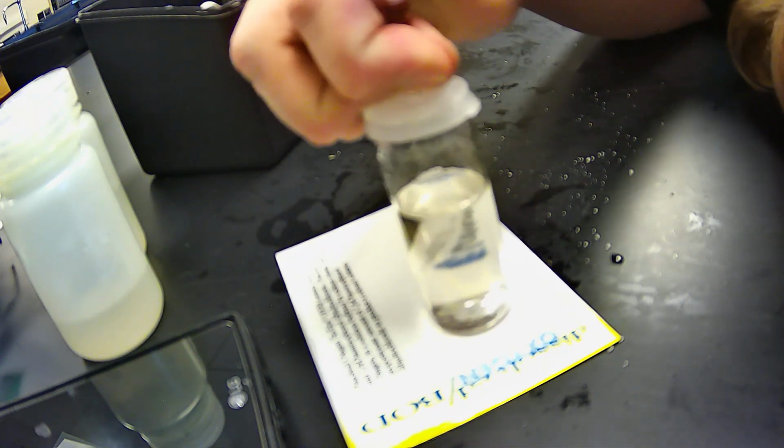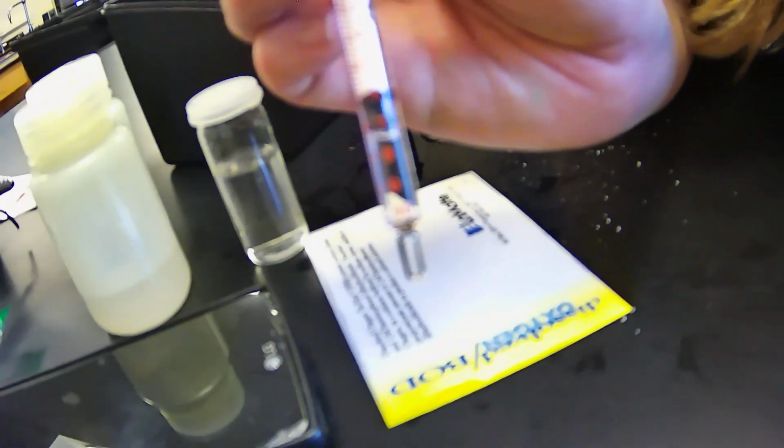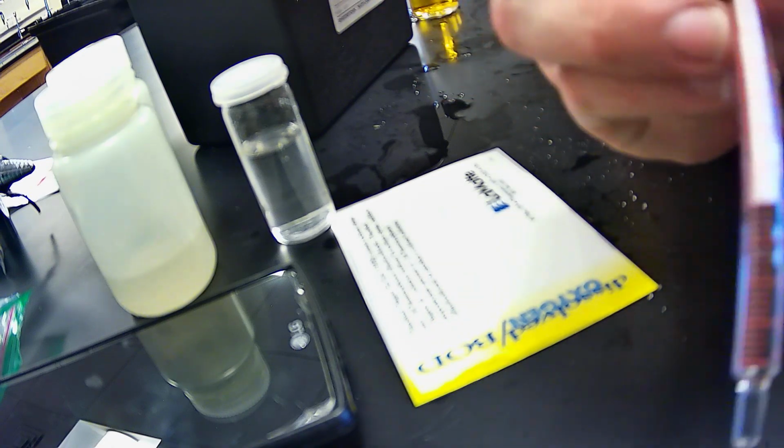So if I read this, okay, and I started at 0, let's see if we can focus in on that. Alright, looks like I'm going to have to help you out a little bit. So we started at 0, and our meniscus is now at 7. So how many parts per million would our water be? Basically, that difference will translate into parts per million.